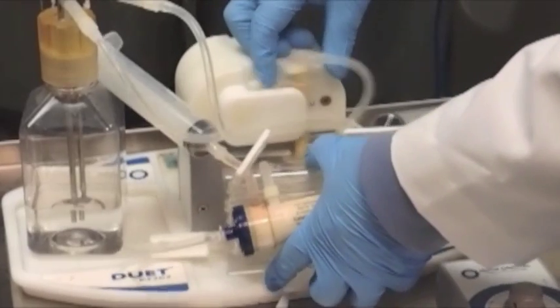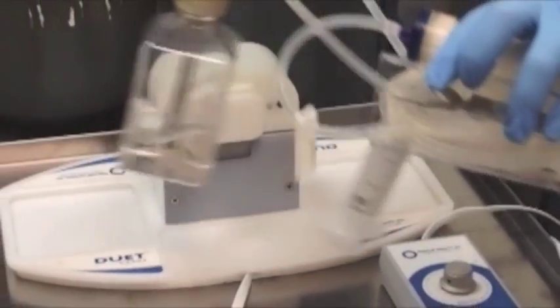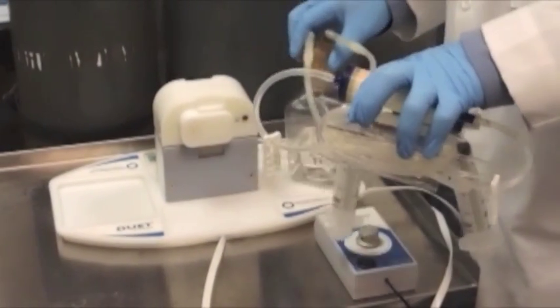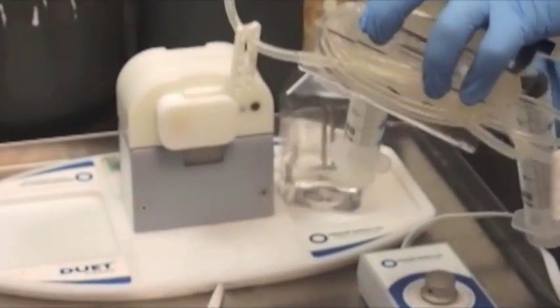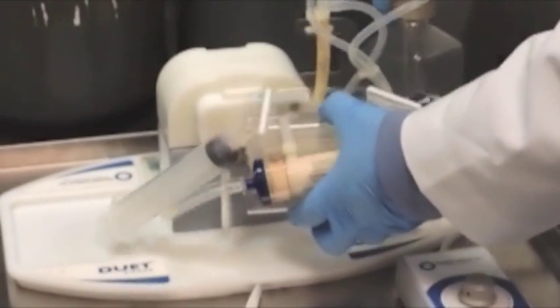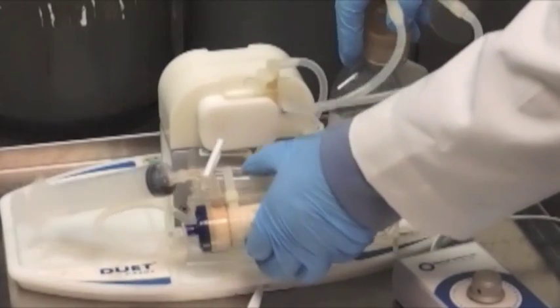You will find it is much easier to insert and remove the cartridge from the pump while the pump is running. You should feel the cartridge snap easily into place upon insertion.